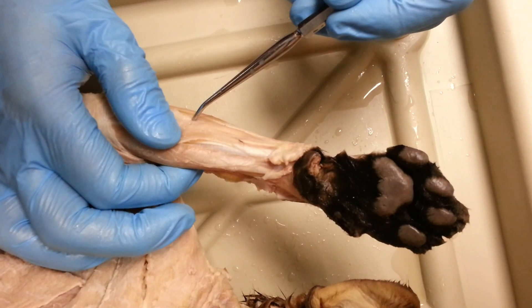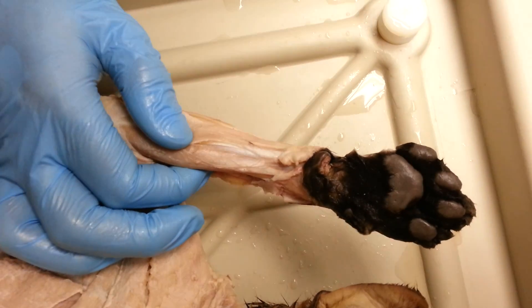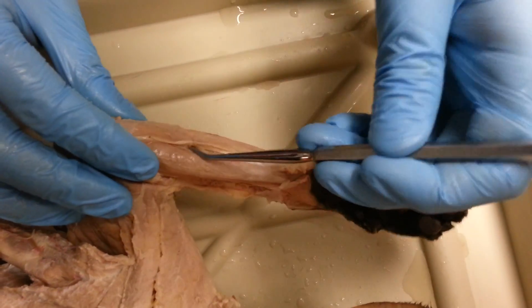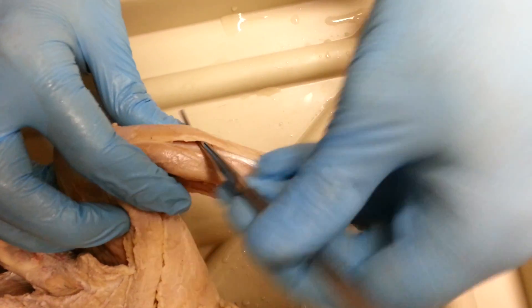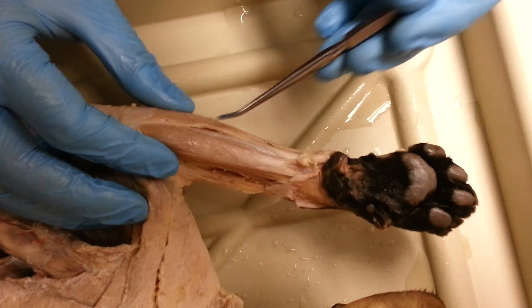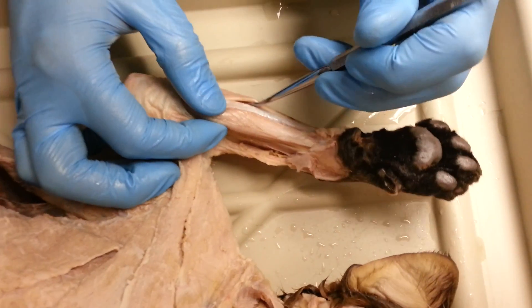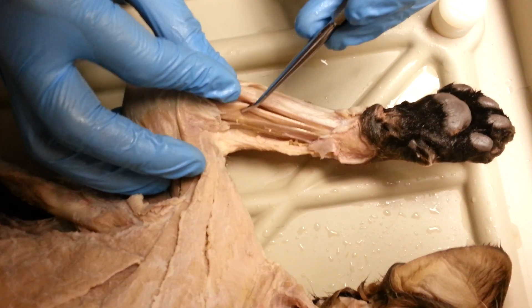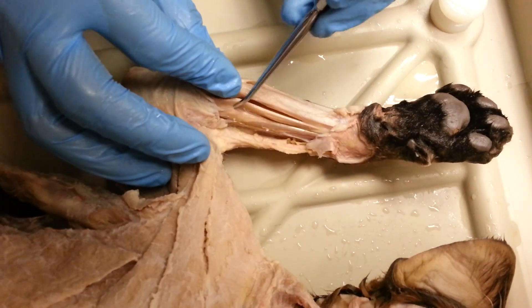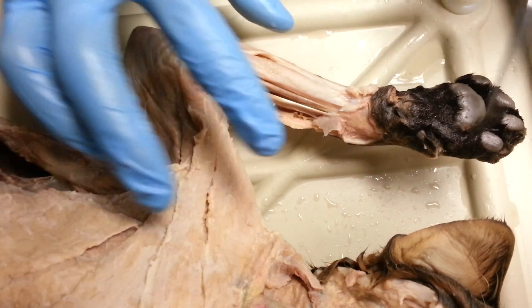All of the ones on the bottom are flexors, and all the ones on the top are extensors. This one is flexor carpi ulnaris. The really long and thin one is palmaris longus. This one here is flexor carpi ulnaris, this one here is palmaris longus, this one here is flexor carpi radialis — it's sort of a two-headed muscle — and then this one right here is pronator teres. That's all the muscles on the arm. There are nine of them.